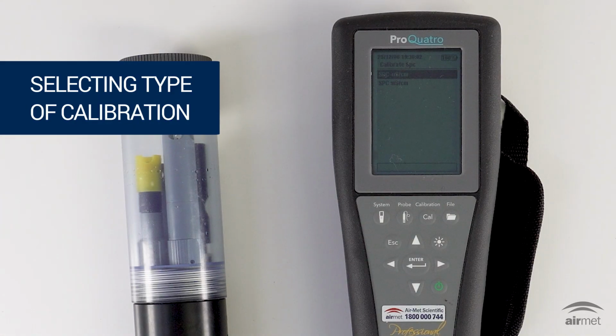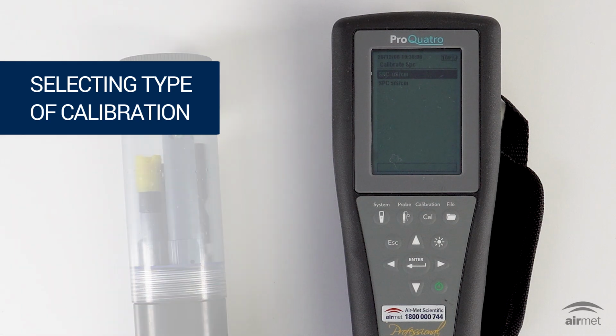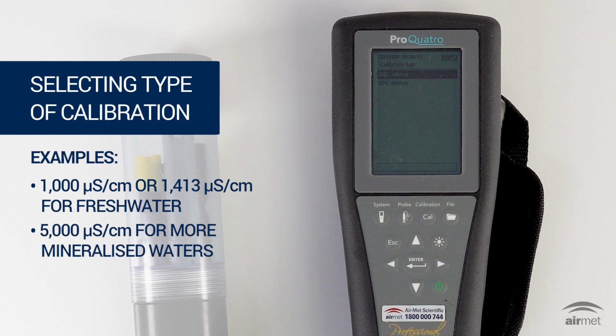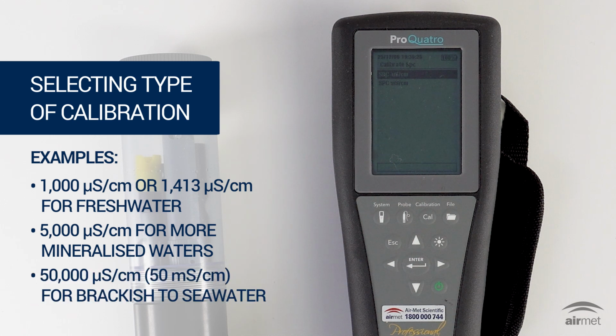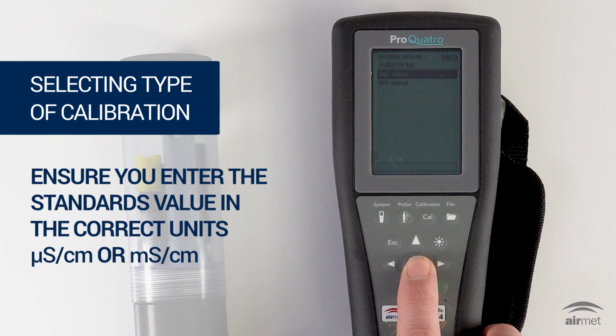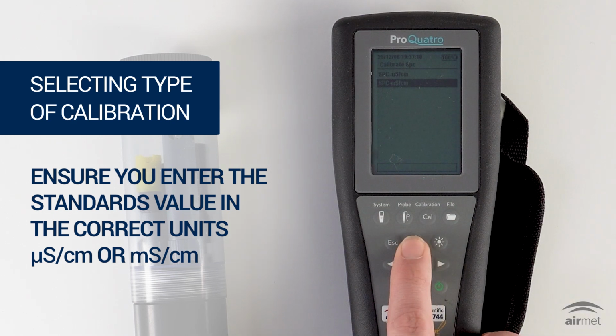Start by selecting a standard. To ensure the most accurate results, use a traceable standard near the typical range of your samples. Examples include 1000 microsiemens per centimeter or 1413 microsiemens per centimeter for freshwater analysis, 5000 microsiemens per centimeter for mineralized waters, and 50,000 microsiemens per centimeter or 50 millisiemens per centimeter for brackish to seawater analysis. Ensure you enter the calibration standard's value in the correct units, either microsiemens per centimeter or millisiemens per centimeter, when prompted.